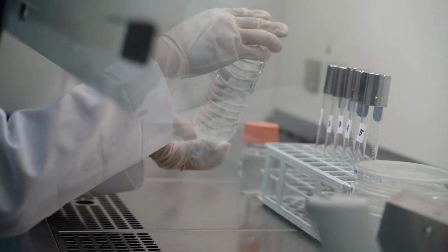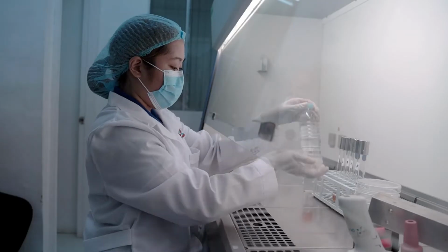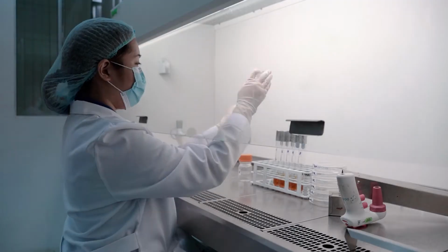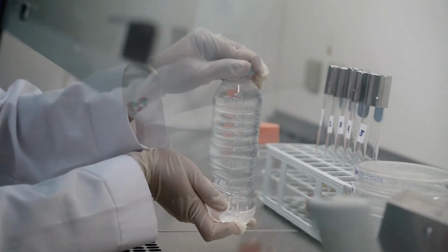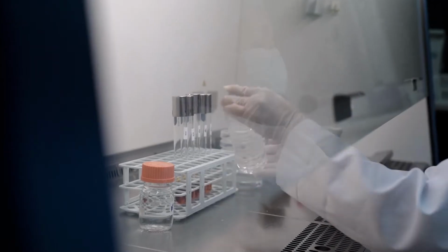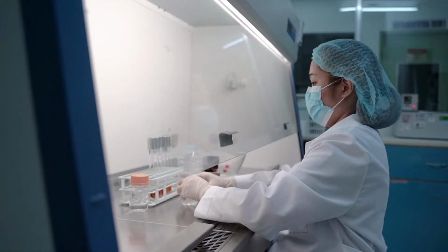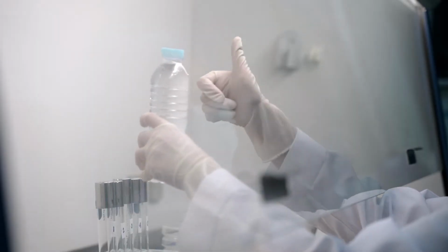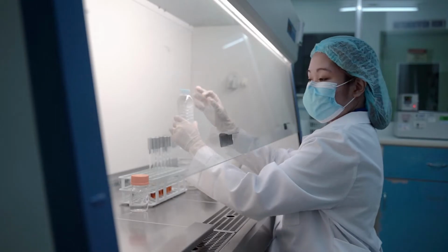Let's thoroughly mix our water sample by rapidly making up and down movements approximately 25 times for 7 seconds by hand. Analytical results depend on adequate sample mixing. If the sample is not adequately shaken, the actual bacterial density could be underestimated. It is important that water samples should not be less than 100 ml, as the volume of our sample should be sufficient to carry out all tests required.